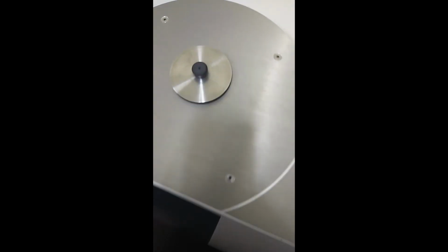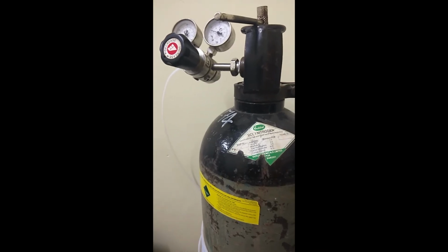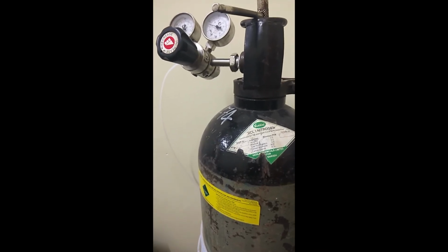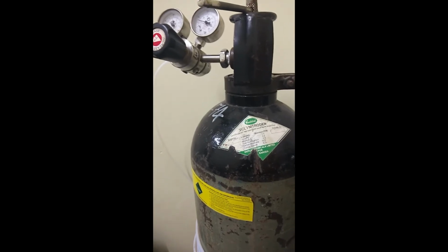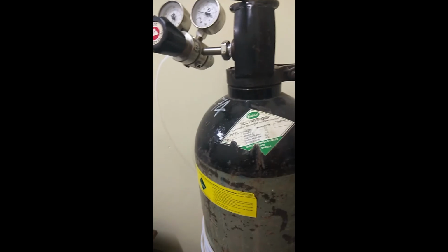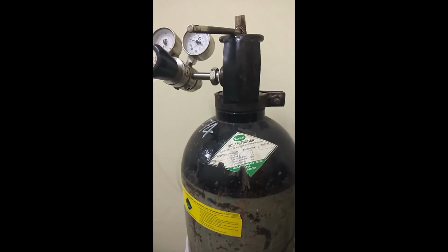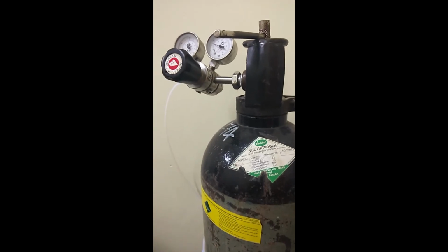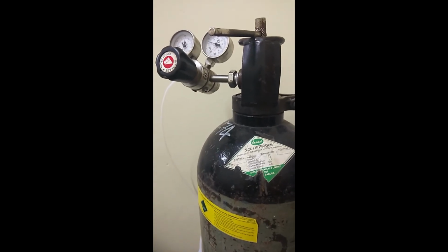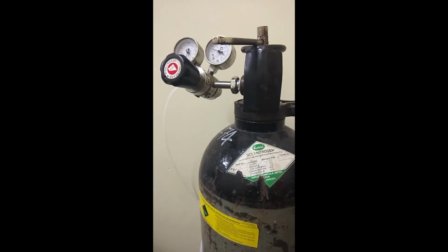And finally, there is the third lid. Before starting the analysis, we use nitrogen. Now this nitrogen is a purge gas which is used in the system, and it is used to create the inert environment inside the furnace. The nitrogen here is supplied in a controlled manner. So now let's look at how the analysis starts and how it looks in the software.